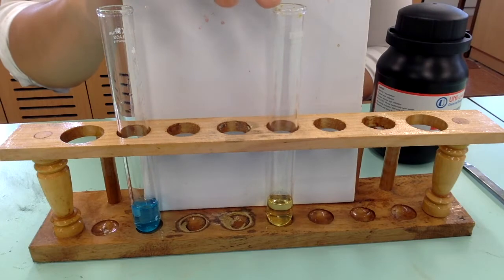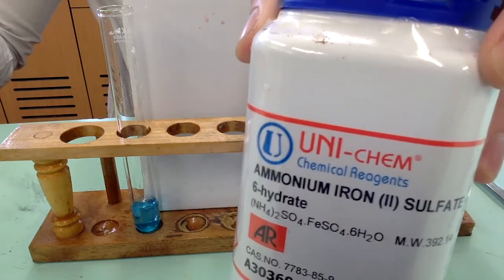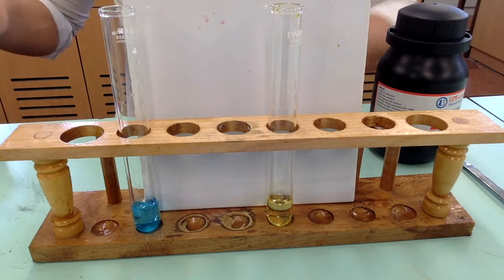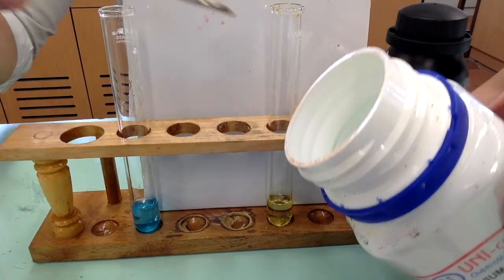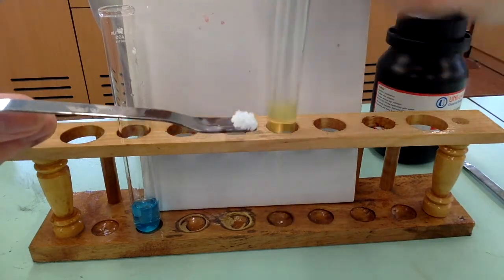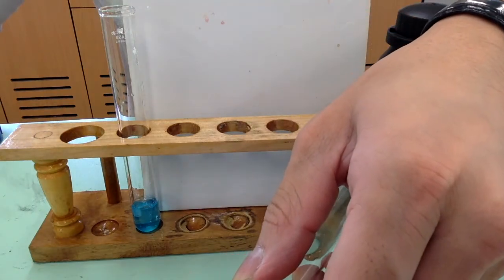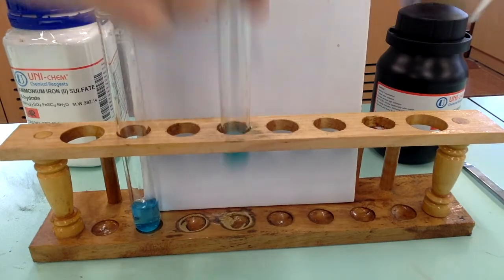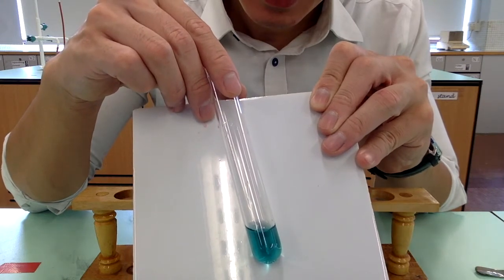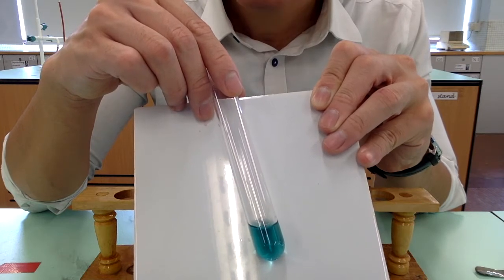To another test tube containing dioxo-vanadium(5) ions, we are going to add iron(II) sulfate. The resulting solution appears blue, meaning that the dioxo-vanadium(5) ions have been reduced into oxo-vanadium(4) ions.